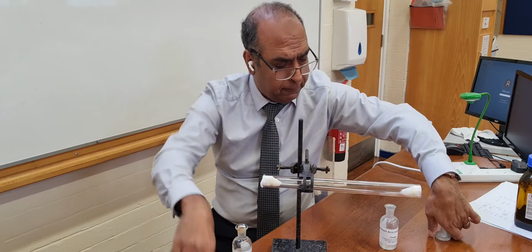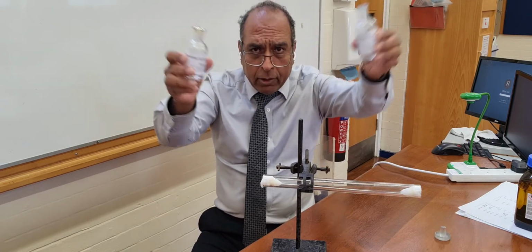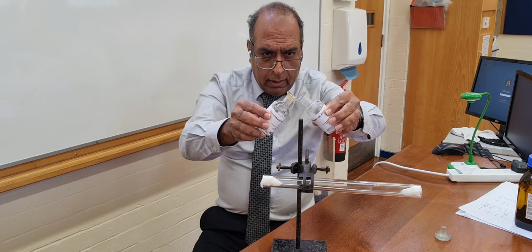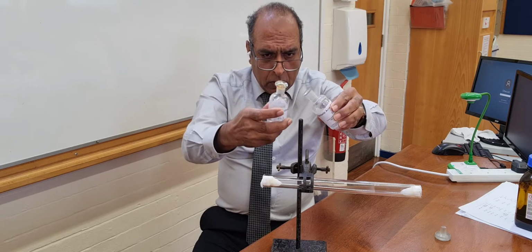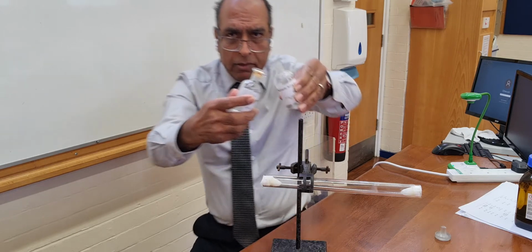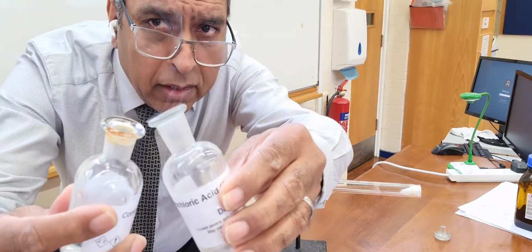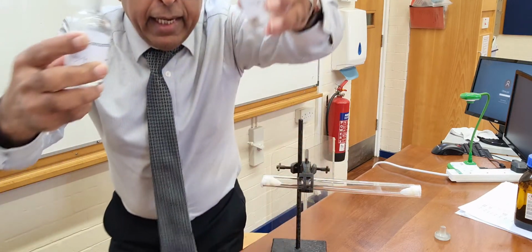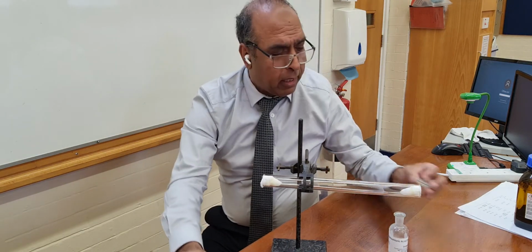Watch, I show you. There's ammonia gas coming off from that bottle. There's hydrogen chloride gas coming off that bottle. And if I put the two together, I don't know if you can see it, but you should see some mistiness there. You see the mistiness? Perhaps if I come close to the camera. Perhaps you see it on my dark skin. The mistiness is where the two gases meet and the two gases make ammonium chloride.